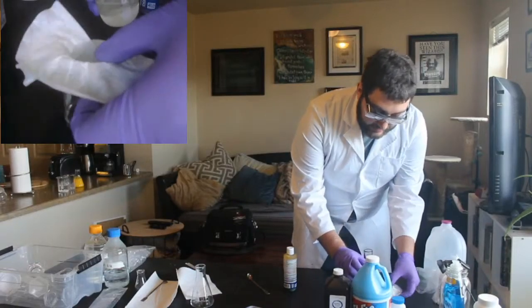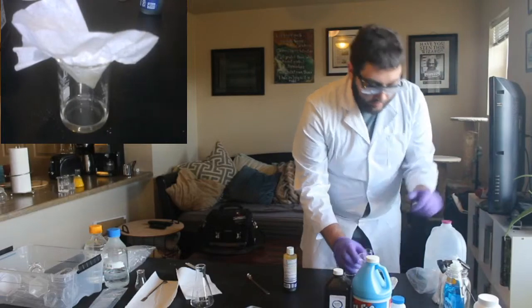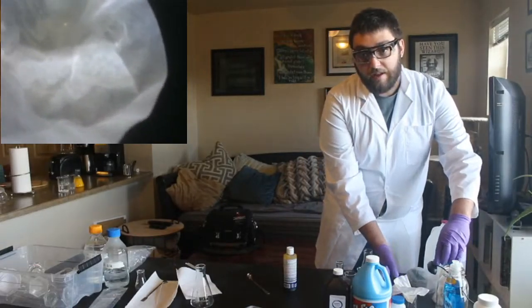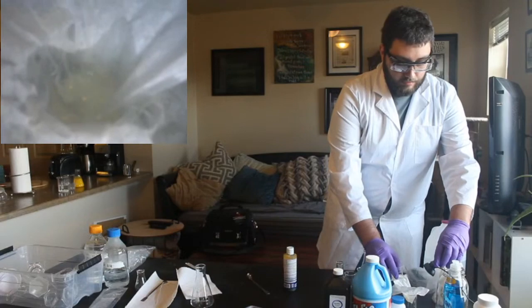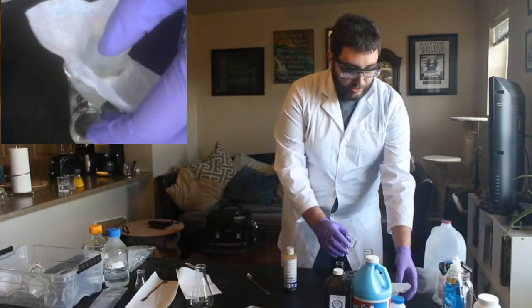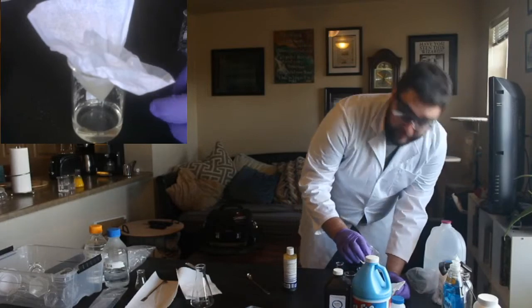So sometimes this can go a little slow. That's okay. And just so you can see what this looks like real deep down. Hopefully that kind of shows it. So it's just going and going and going. We have to wait a little bit for it to drain and drip, and then we just keep topping it off.